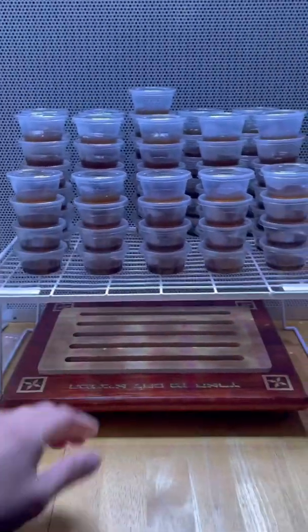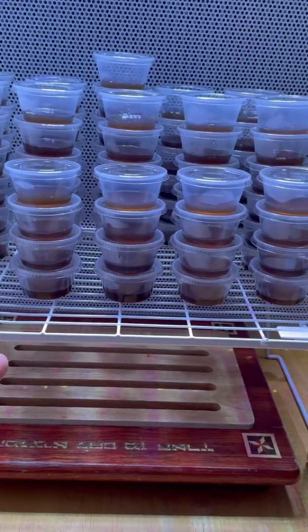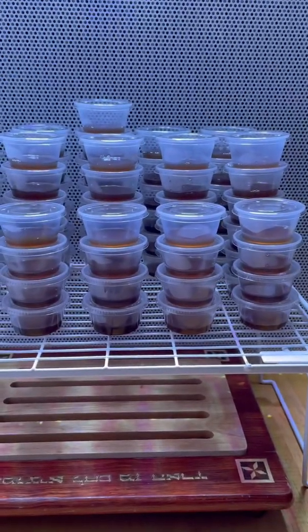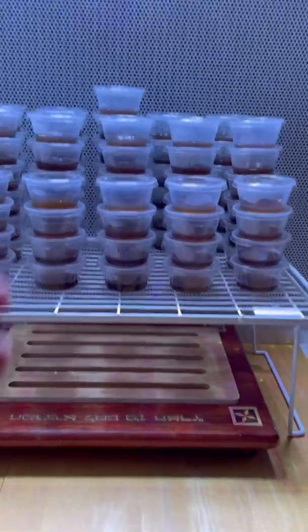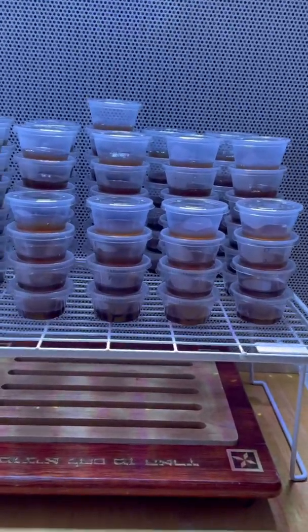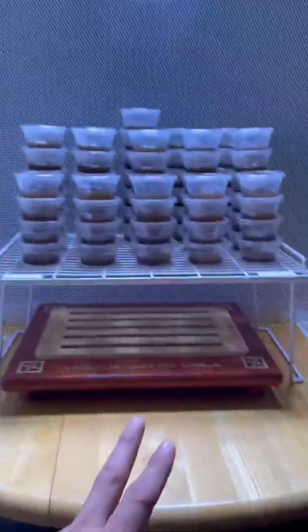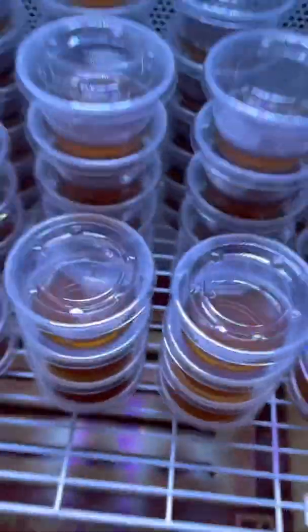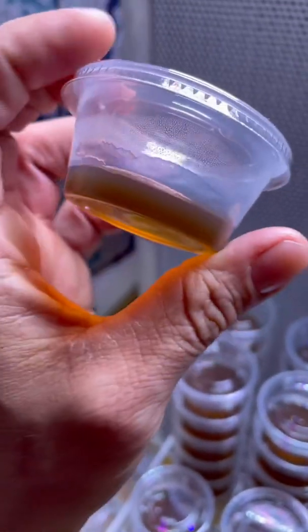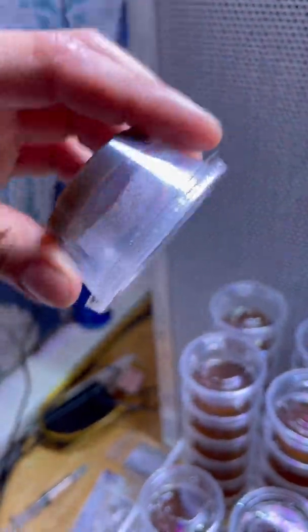Now, I tried something new this time. I didn't do that, but I poured them and left them here. I left the flow hood running for like half an hour to an hour. I have it on a timer, so it runs for 15 minutes and stops for 5, then another 15 minutes, stop for 5. These have been sitting here for a couple days, but if you see this, there's just a little bit of condensation on the sides, which honestly is not a big deal.